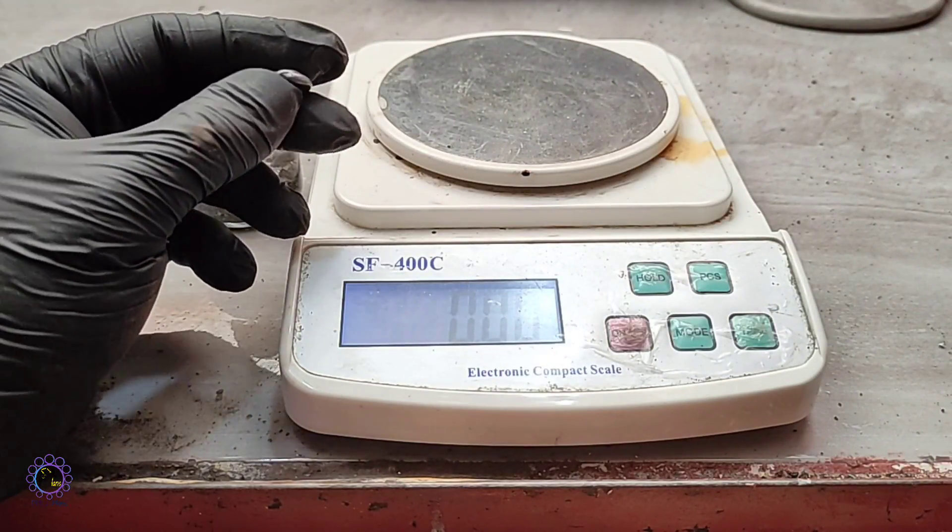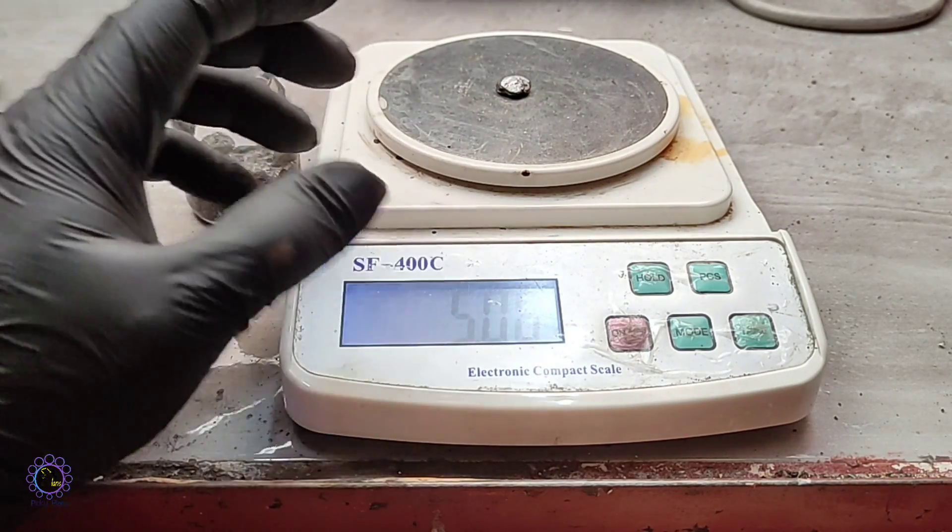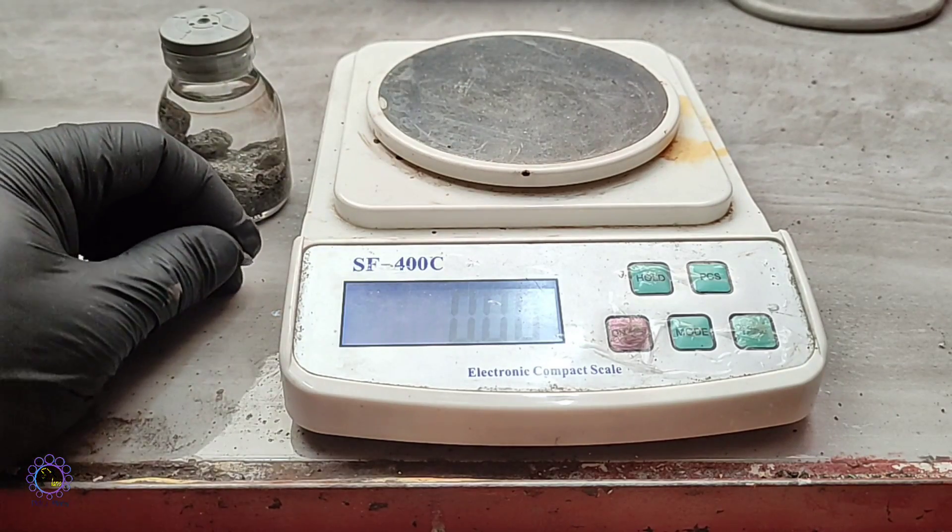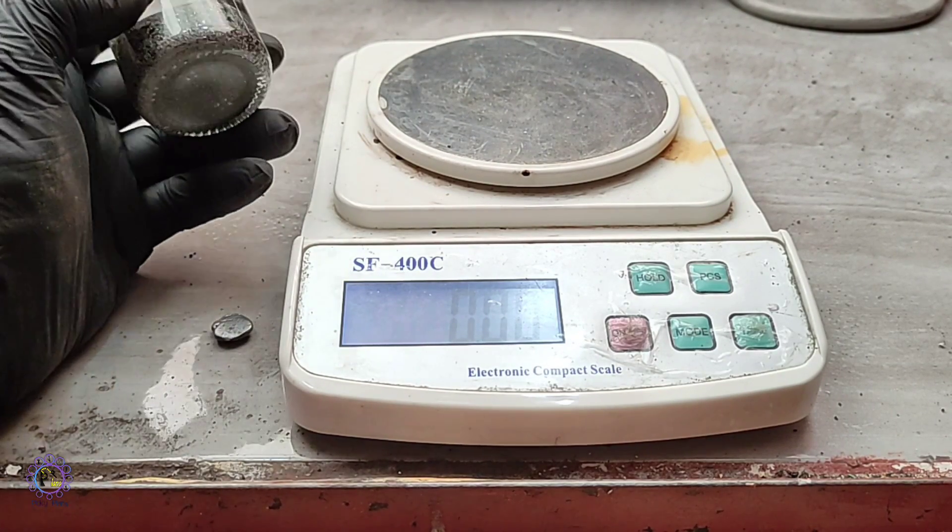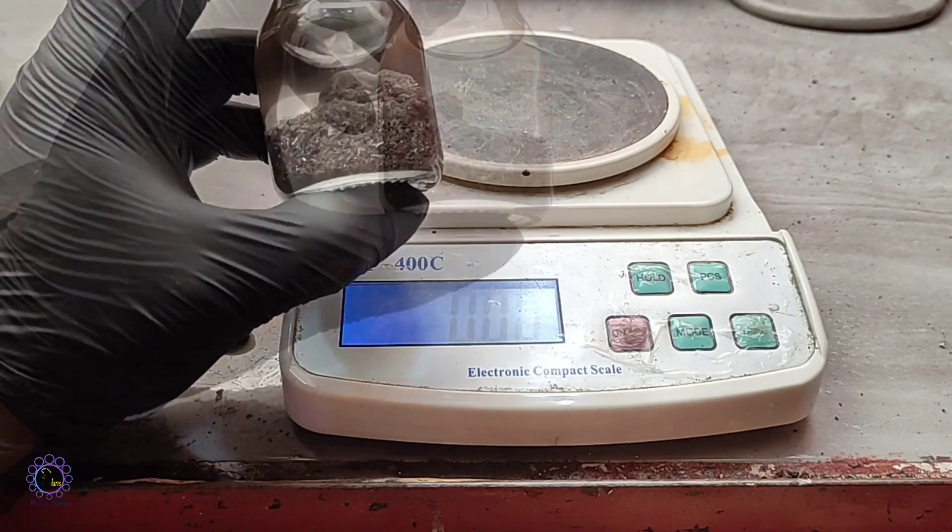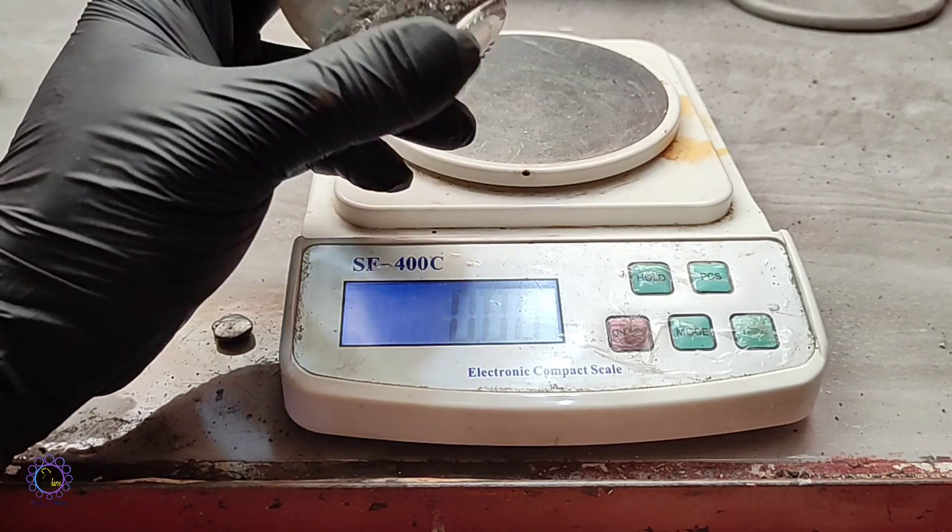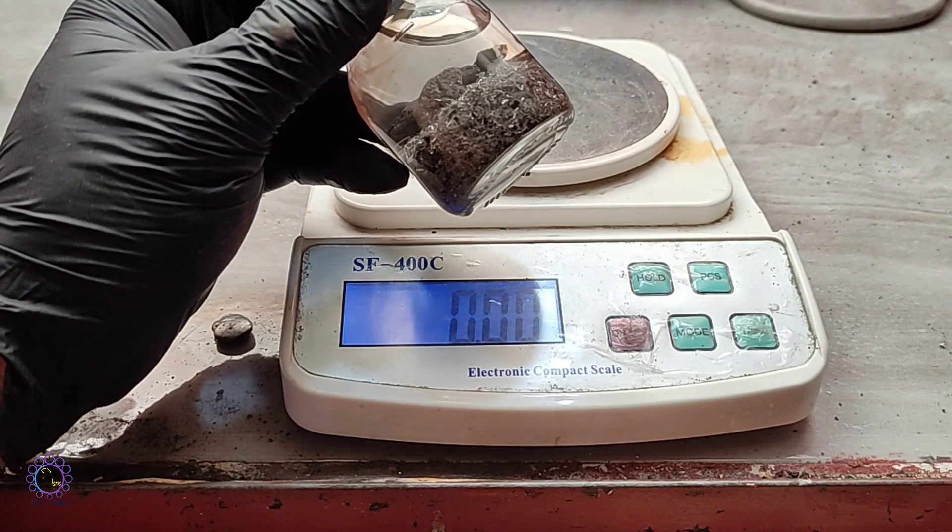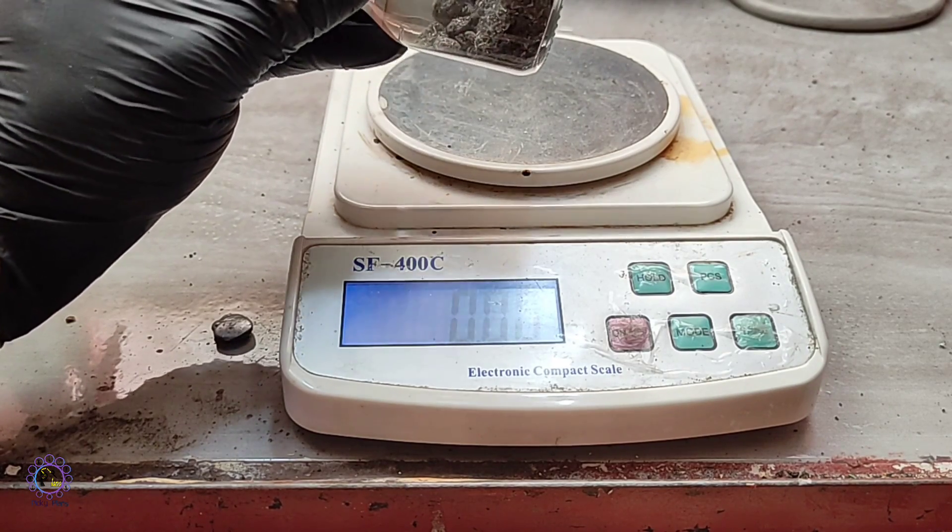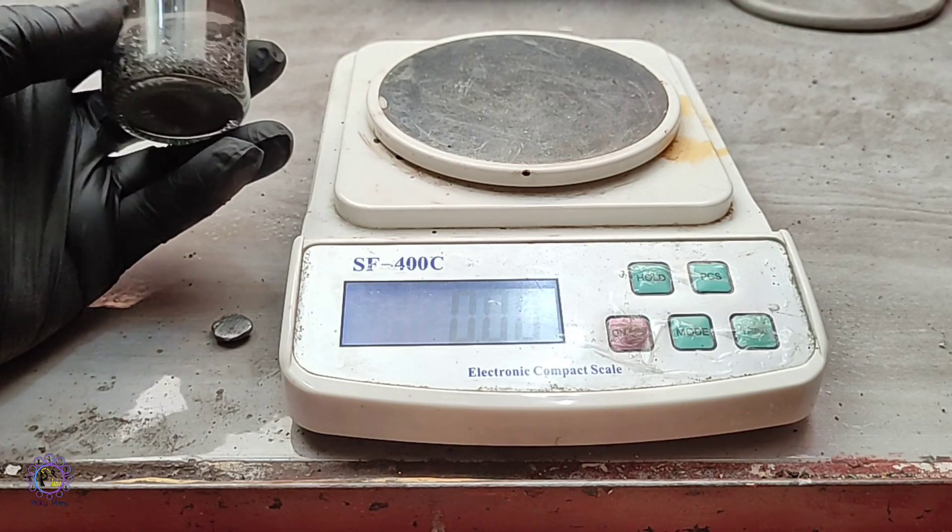And eventually, as the result, we managed to recover about 5 grams of lead metal. I really didn't expect that for an arc furnace to be capable of recovering even as much as 5 grams of lead metal. That's pretty good for exploring science. And here are the crystals of tin metal, pure crystals which been recovered through electrolysis. I've dipped it in water immediately after washing to prevent oxidation. And it is roughly about 25 grams of tin metal been recovered from 50 grams of solder wire. And it's pretty good, since total tin content of solder wire was predicted to be about 31 grams of tin metal per 50 grams of solder wire. But here is about 25 grams which is pretty good.